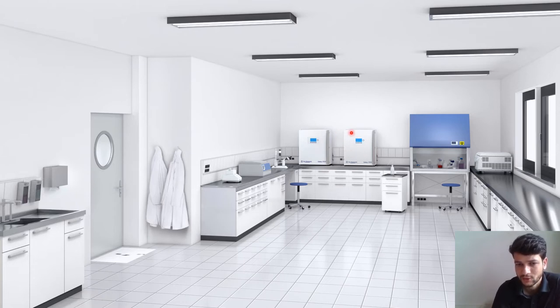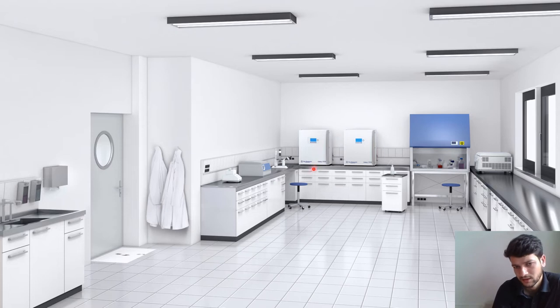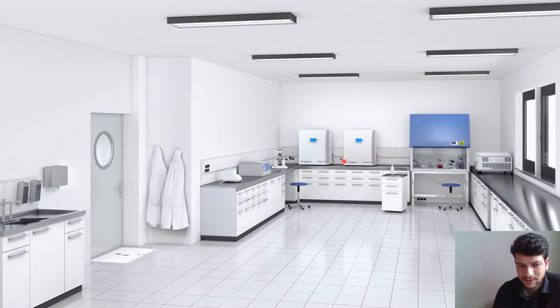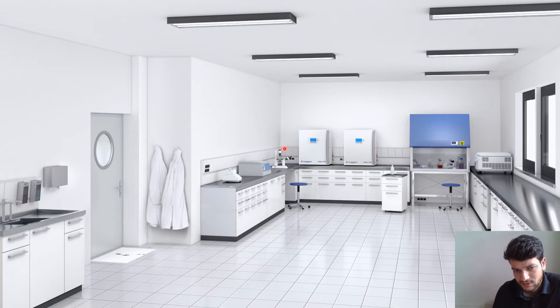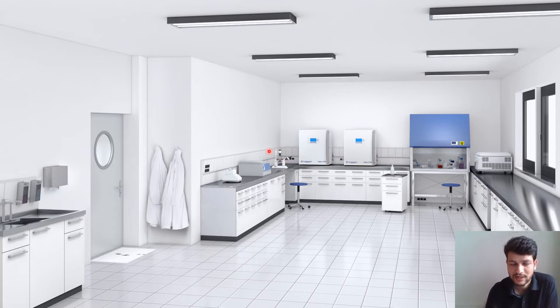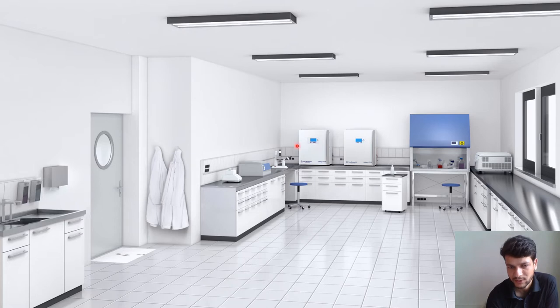In this picture you can see two machines — these are incubators. The incubators maintain the full physiological condition: temperature of 37 degrees centigrade, 5% CO2 concentration, and relative humidity. All instruments in this room should be clean and there should be no contamination. We also have a microscope because on a daily basis we have to look at the cells and check their condition.